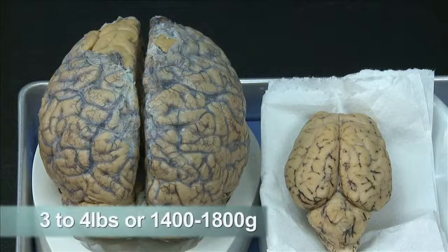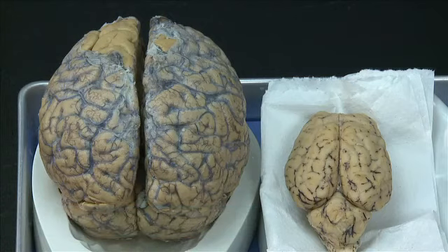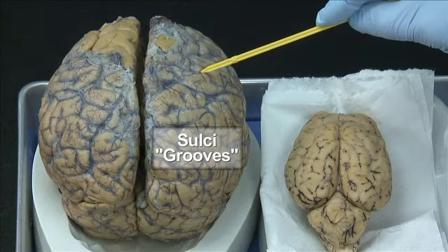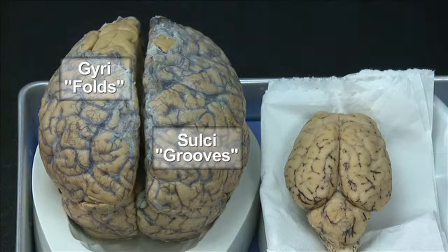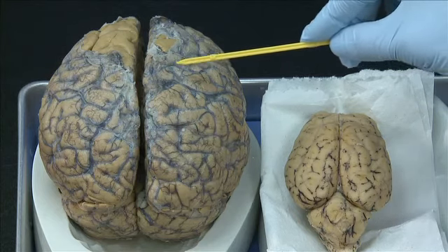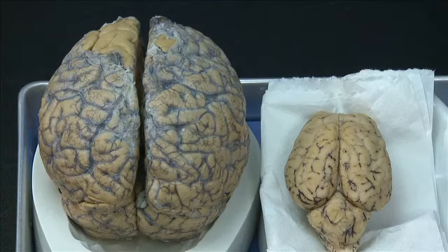Human brain weight is around 3 to 4 pounds, while the sheep brain is around 140 grams. The human brain has a significantly larger number of sulci, which are grooves, and gyri, which are folds. Sulci are also deeper. This pattern of sulci and gyri increases the surface area of the human brain and its complexity.